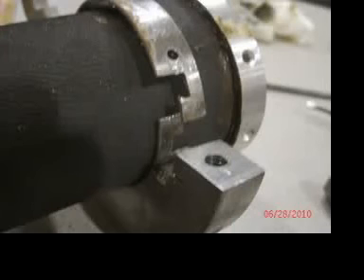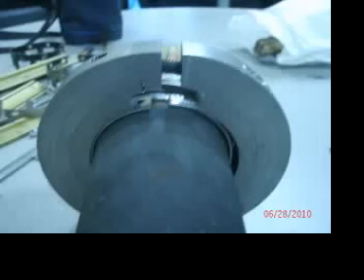The purpose of this tool is to actually do the otherwise near impossible task of holding the snap ring together so that you can connect the ends. And what you have to do is to place it over the snap ring, kind of hold it together by hand, and then put the bolts in to secure it.